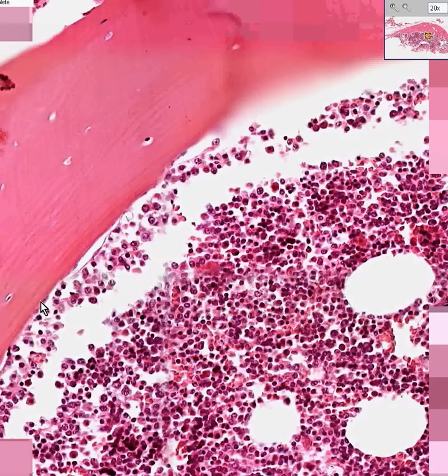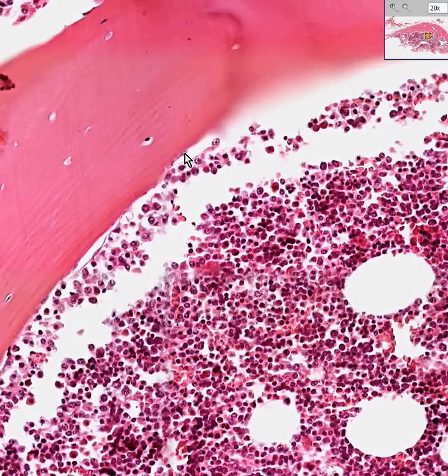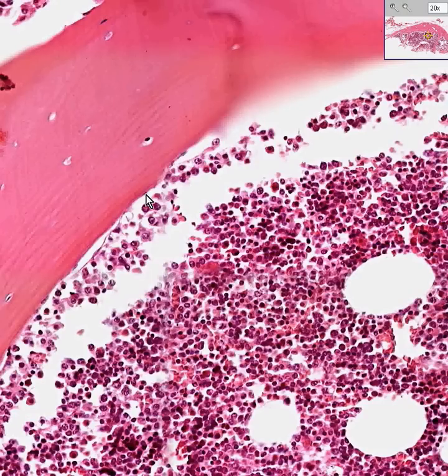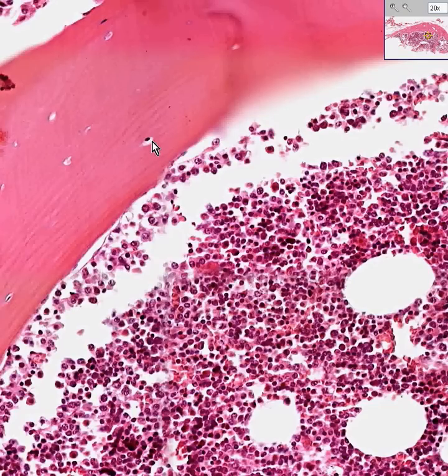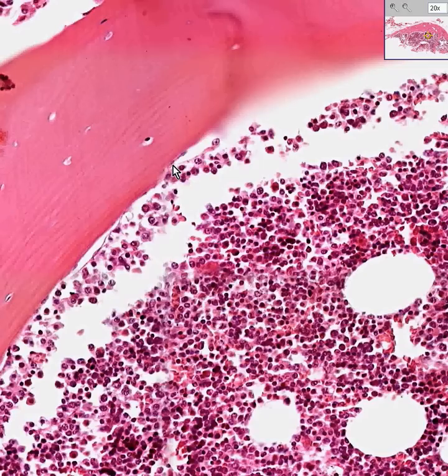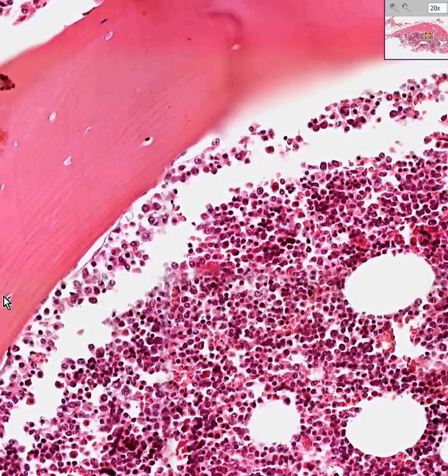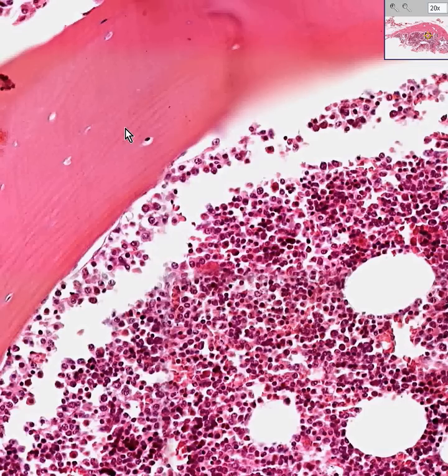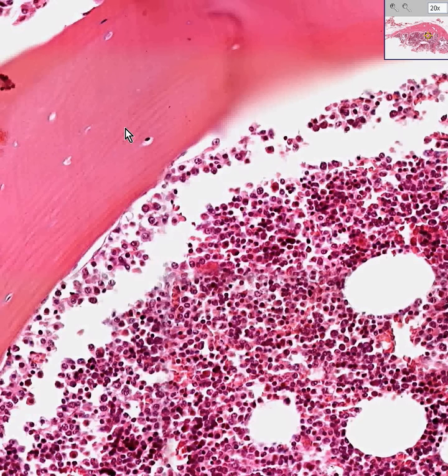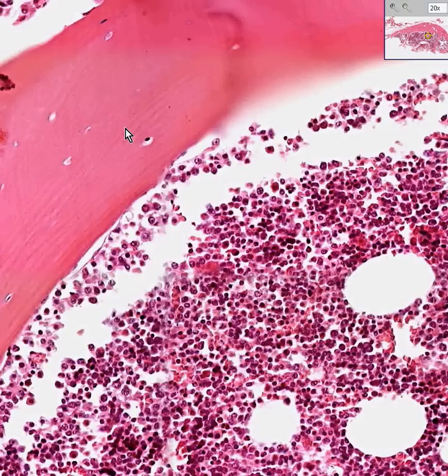Let's take a look at something — we could definitely call this cell, this cell, this cell as being osteoblasts. As the bone is formed and they're trapped within these concentric lines, these osteoblasts become osteocytes, just like we saw in Haversian bone — and very similar to the way we saw chondroblasts at the periphery near the perichondrium become chondrocytes within the middle of the matrix.